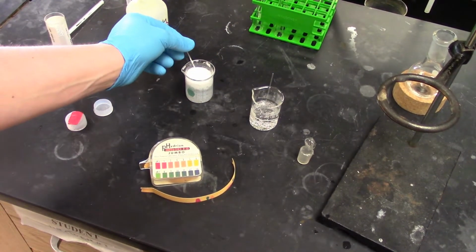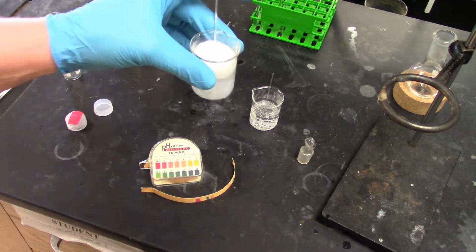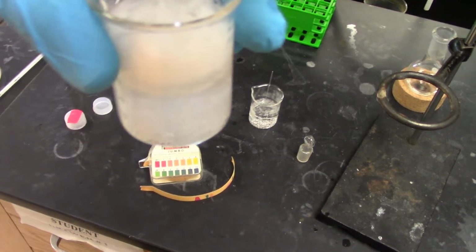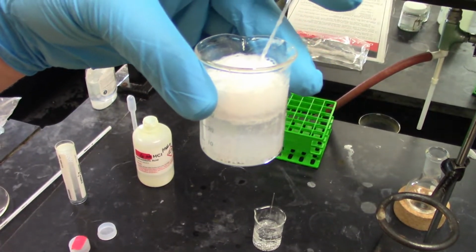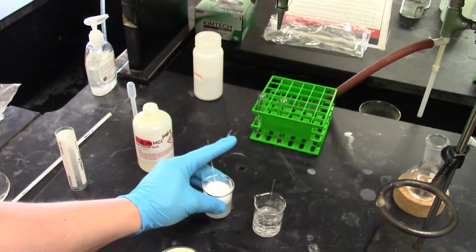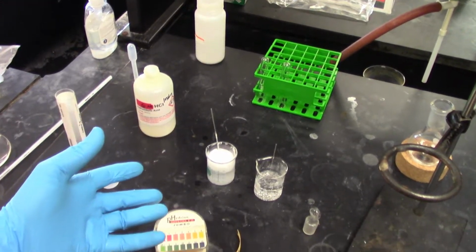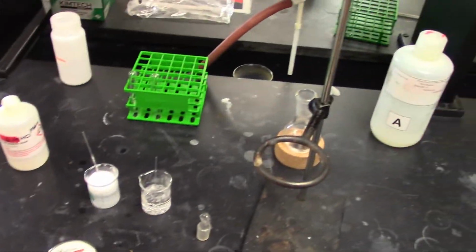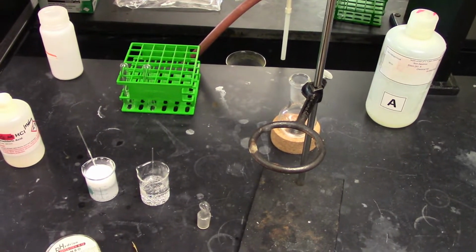But when we look at solution A here, that's exactly what we see. That's what this foam is, our precipitate coming out of solution. So back it out for a little bit. So solution A definitely contains some precipitate, solution B did not. So we're going to take solution C here that I kind of got tucked off to the side, and we're going to run this in the rotovap, and we're going to see what comes out with the rotovap.